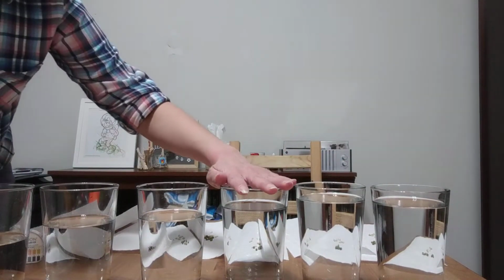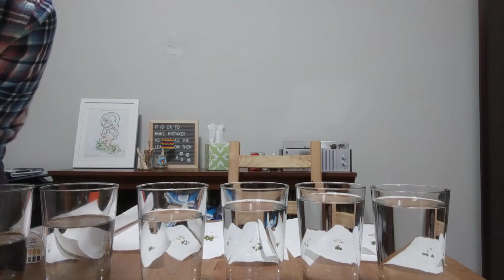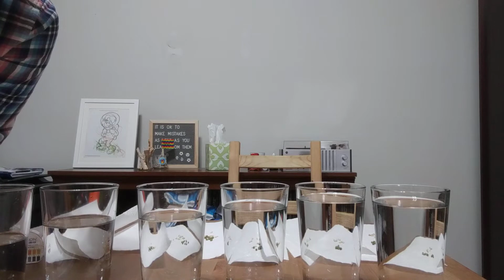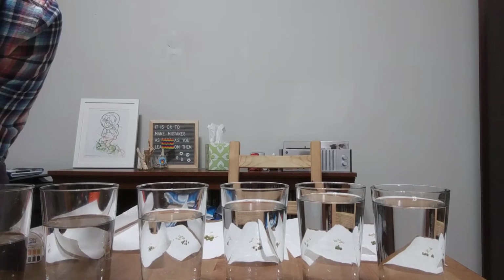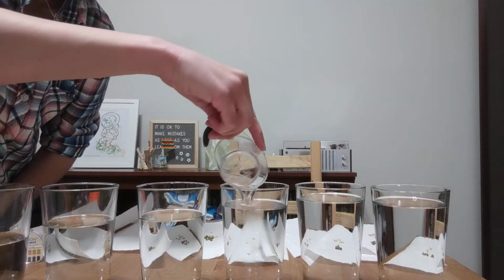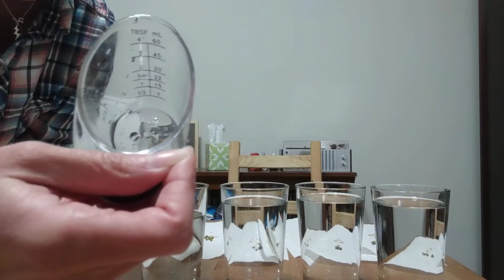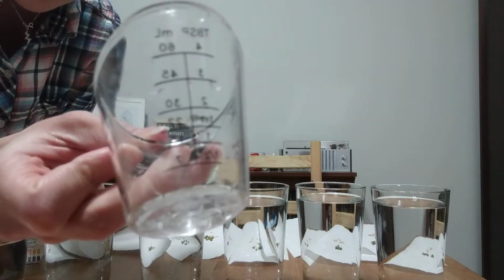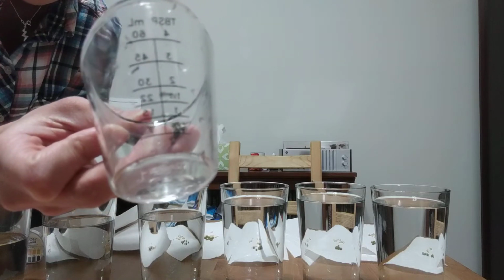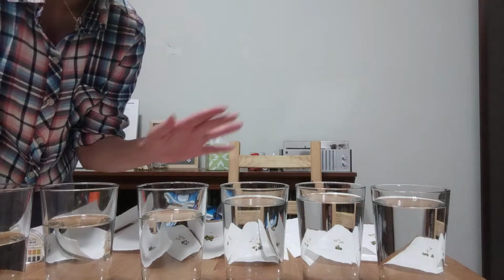All right, next we have, this one has 375 mils of water, so I'm going to put 25 mils of vinegar. So you can use that to get your data. And I do want to point out, I've got to pour a little out of this one too. All right, 25 mils. I do want to point out, if you can see this, it is not able to measure exactly 25 mLs. It measures 7, 15, 22, 30, 45, and 60. So I'm having to do a little estimation, so that may come in handy later.